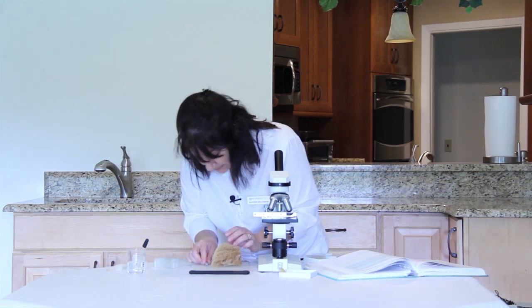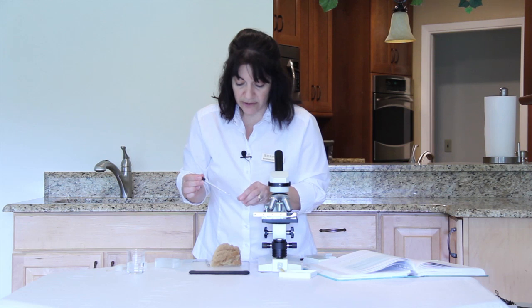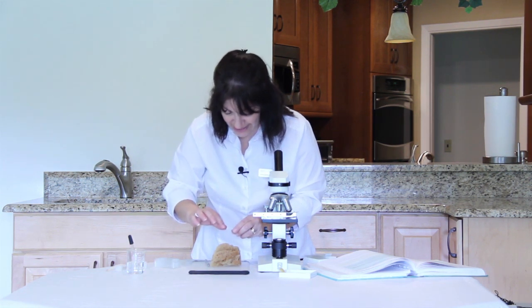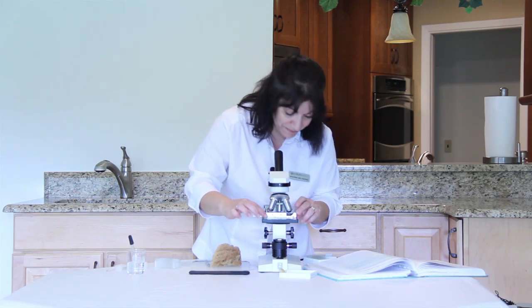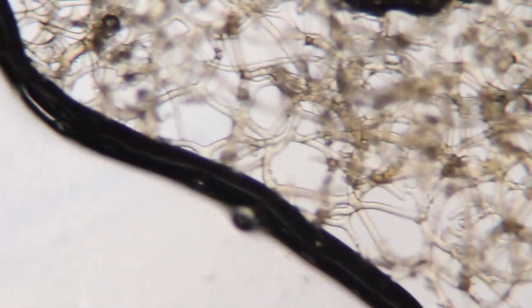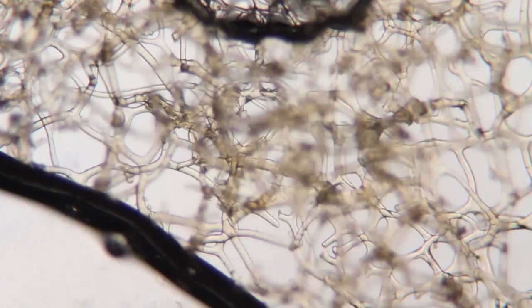And then grab a blank slide, put a drop of water on it, and put your little sliver of sponge on the slide and put a cover slip on it. And then take a look at that under the microscope, under lowest of power. And these are obviously not living sponges that you're using. So you're seeing the skeleton of the sponge here. This would be then the spicules, and maybe some dried spongin material as well.